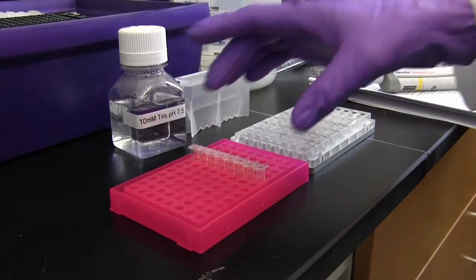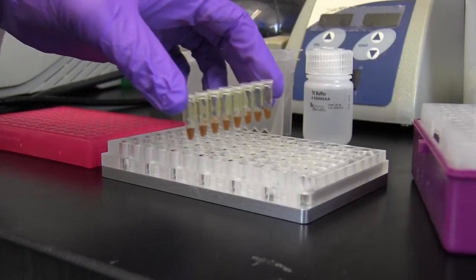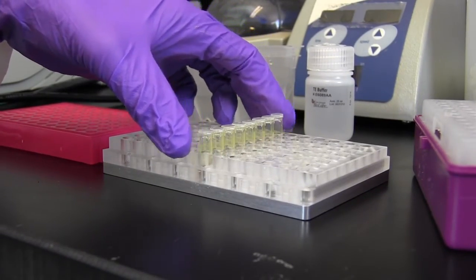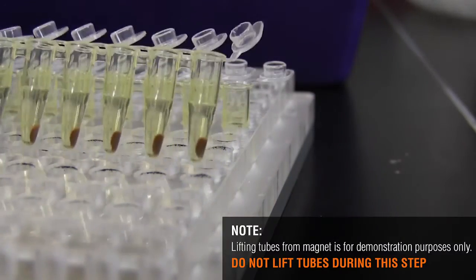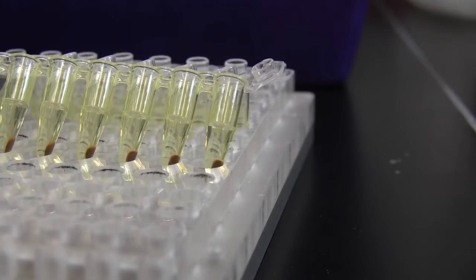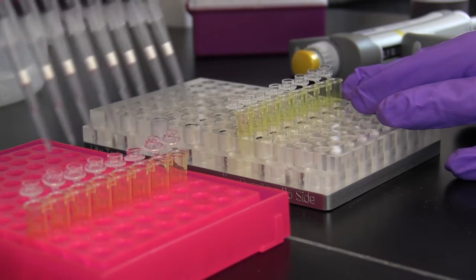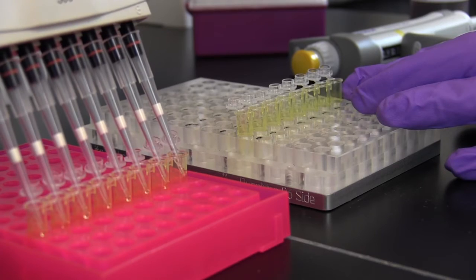Incubate for an additional 2 minutes at room temperature. Return the sample to the magnet for 5 minutes or until the sample clears and remove 15 microliters of the supernatant. Add this 15 microliters to a fresh PCR tube for library amplification.